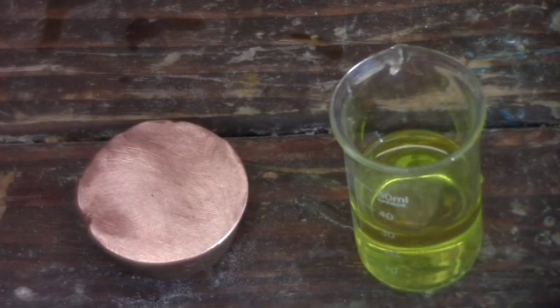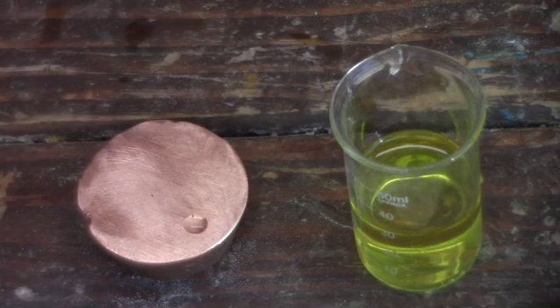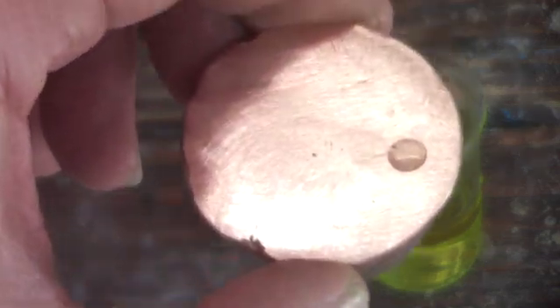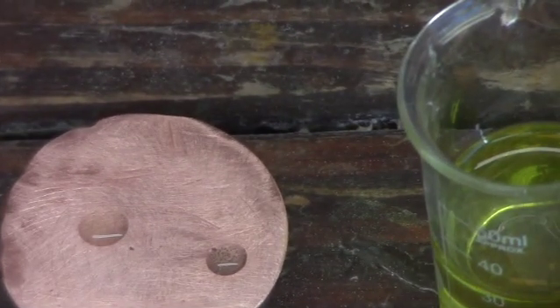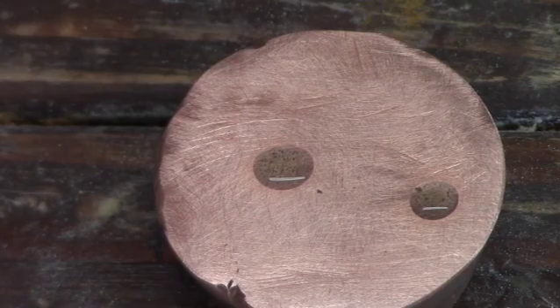After filtering the guck out of the aqua regia from the old paper filter, we're going to take a sample of it and drip it on the copper to see what color we get. I am seeing a bit of a greenish tint, which indicates that we have nitric — which it should, since we've overdosed it and have not yet started denoxing. Just for color comparison, I'm putting another drop of the aqua regia onto the copper. Eventually both will turn green, and after about a minute we see they've both turned green.